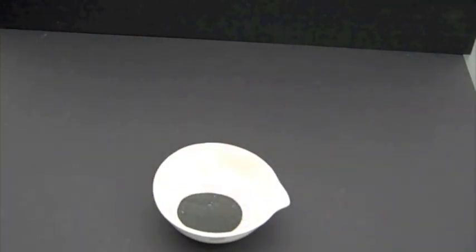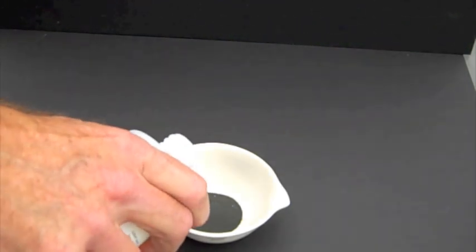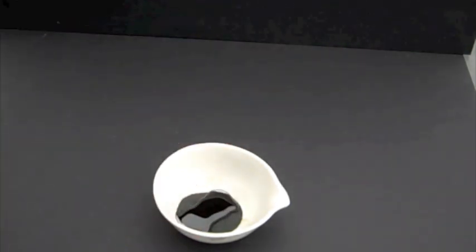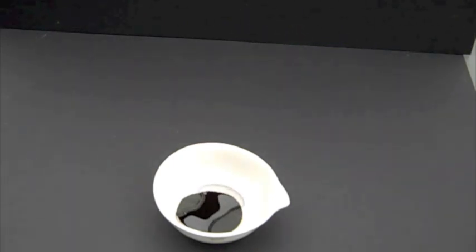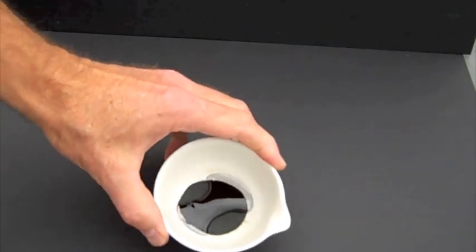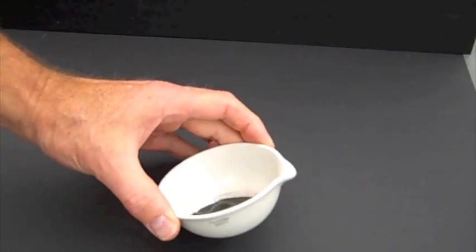And stand back and watch what happens. Just a little bit like that. Let it touch all the permanganate.